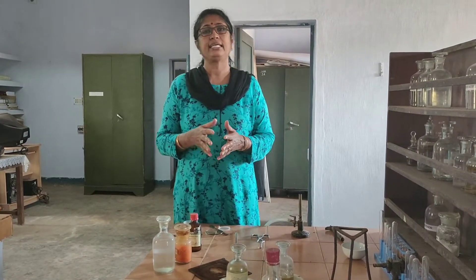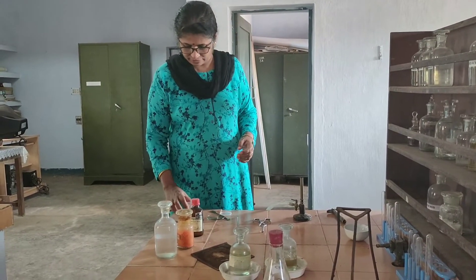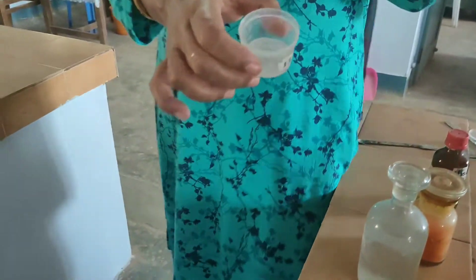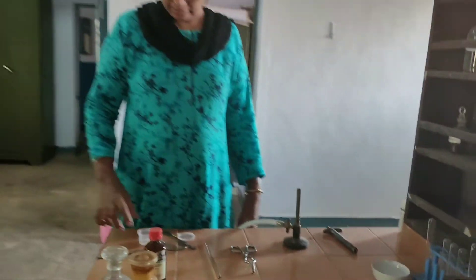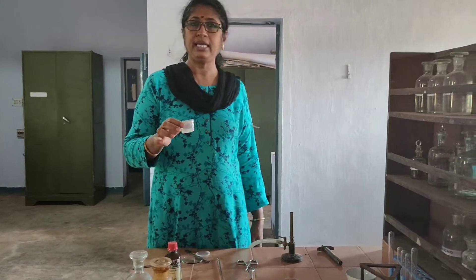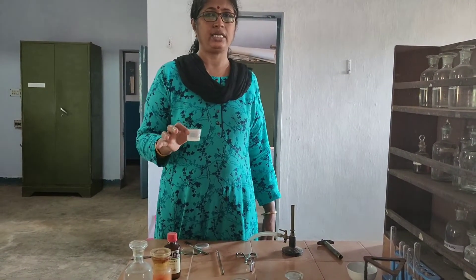A salt has a cation and an anion. First, we will have to do some preliminary experiments. One is the color and appearance of the salt. The salt I have given you is crystalline in nature, but since it is hygroscopic — meaning it absorbs moisture from the air — it has become liquid. Otherwise, it would be a colorless crystalline salt.